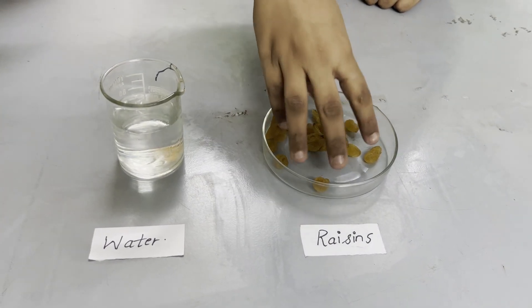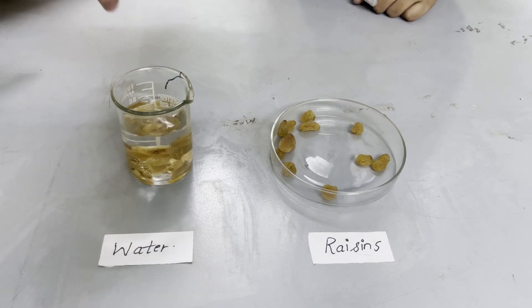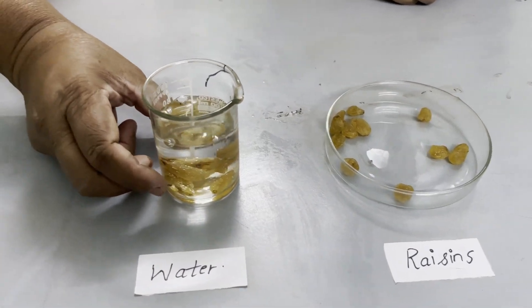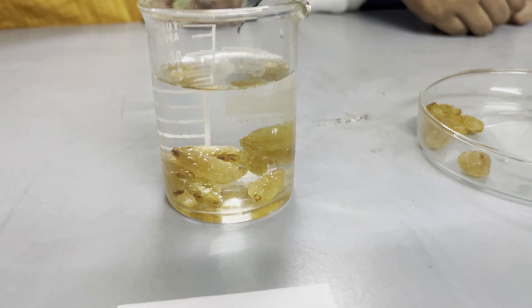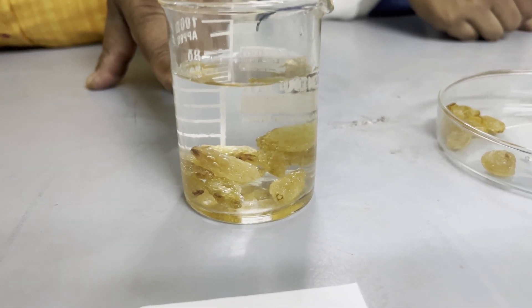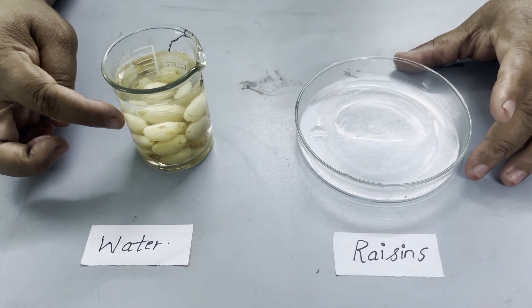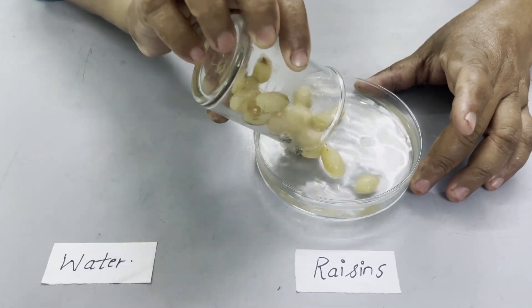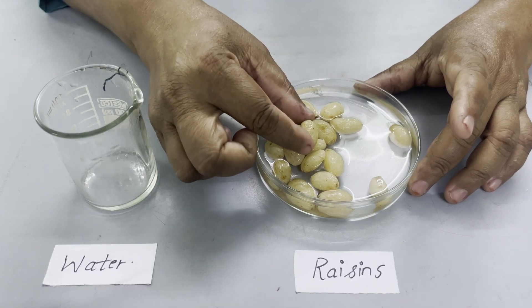Take raisins and put them in the beaker. Water is already in the beaker. Keep it for some hours and after some hours we will see the change in the raisins. After few hours you can see the raisins have swollen. I will put them in the petri dish. The raisins have become turgid.